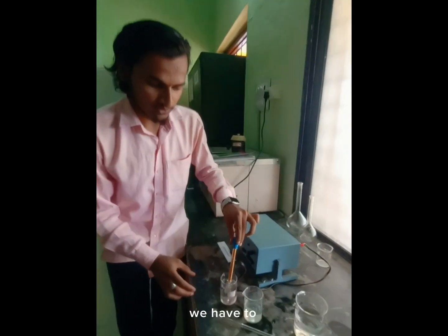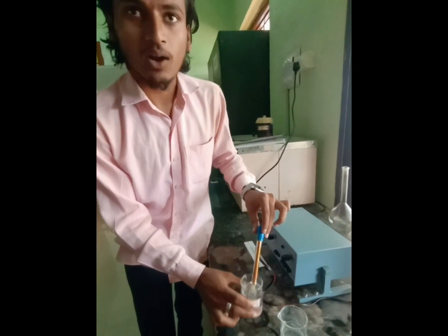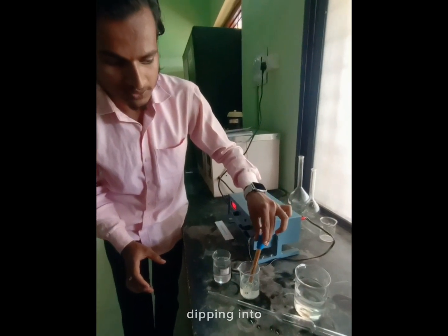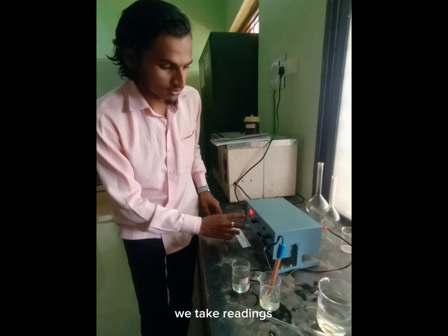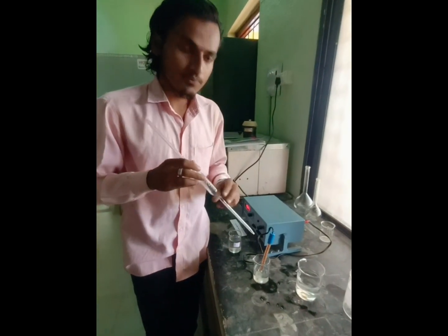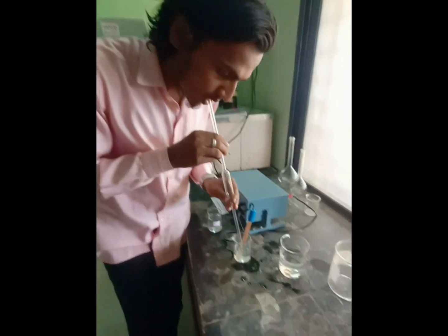Before this, we have dipped the conductivity cell in distilled water. Now we are dipping it into this solution and we are going to collect the readings. After taking the reading, we have to pipette out 25 ml of KCl.